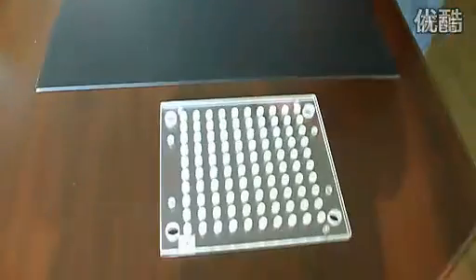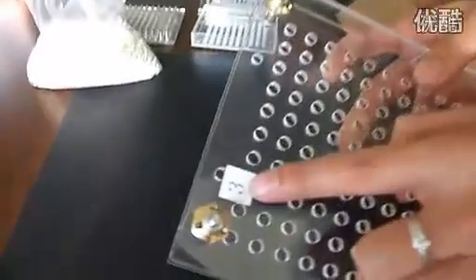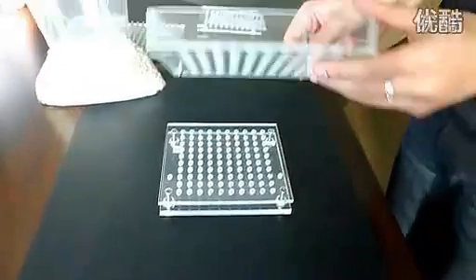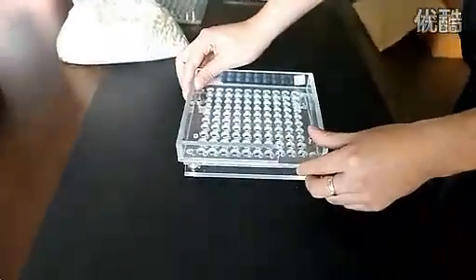Now take the bottom sheet. Fix the encapsulation sheet to the bottom sheet using the stainless steel pegs to fix it correctly in place.